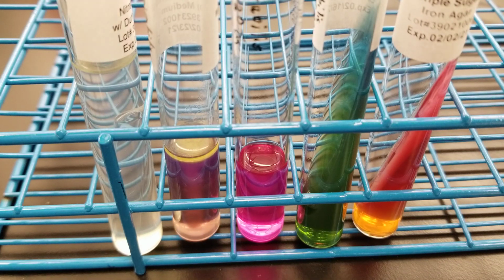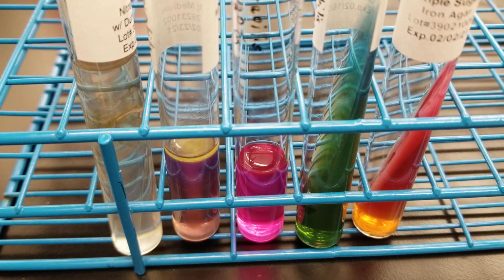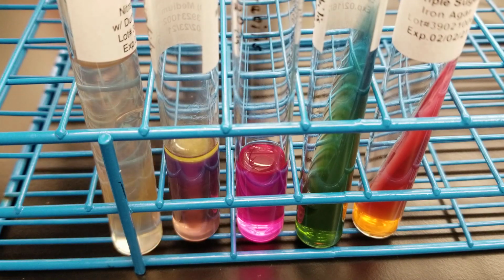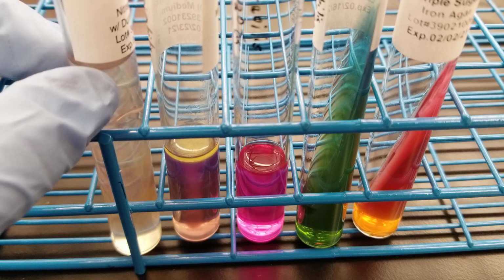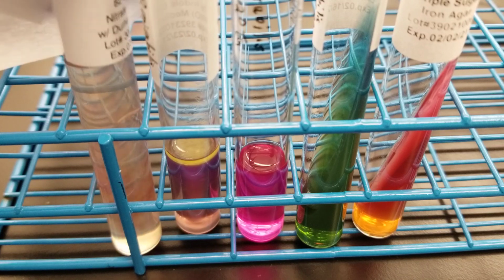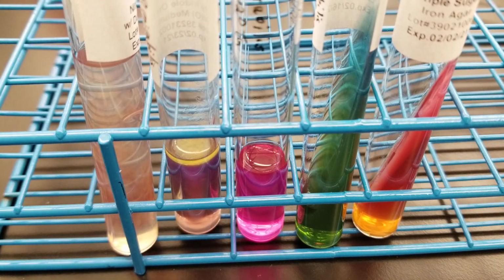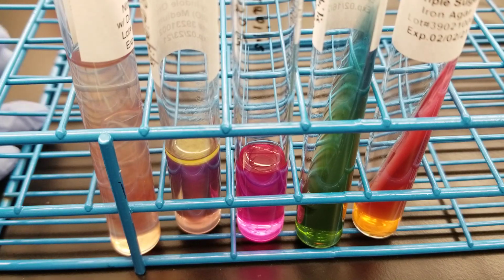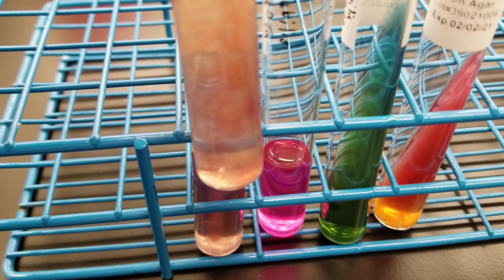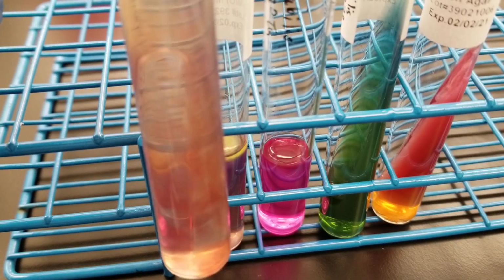Now let's do our 5 here. 1, 2, 3, 4, 5 for A, and reagent B will have 5. 1, 2, 3, 4, 5. And observe for red color, nitrate reduction. And it's already starting to turn red. You're supposed to give it up to 3 minutes. Again, we're not having any trouble with that. It's immediately turning red. We don't have any gas showing in the Durham tube, but that red is really happening.